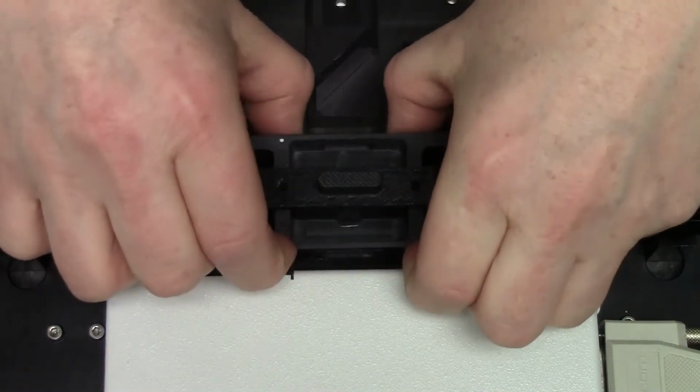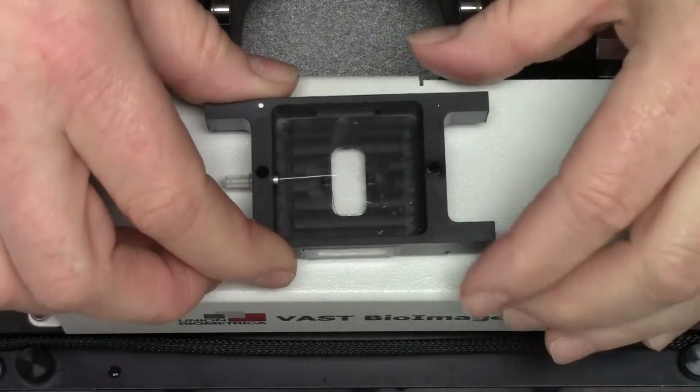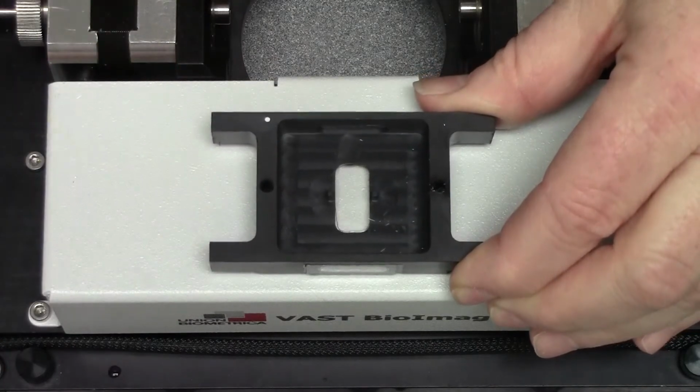Remove the entire tray from its mount in the center of the vast. Avoid touching the glass windows on the tray. Separate the guard from the tray, discarding the broken capillary and rinsing the tray of all debris before installing the new capillary.